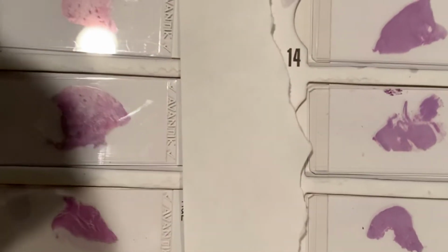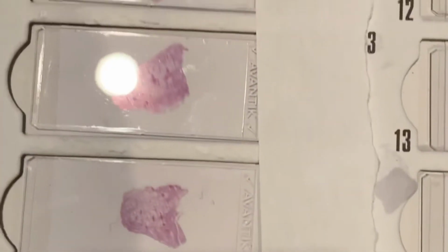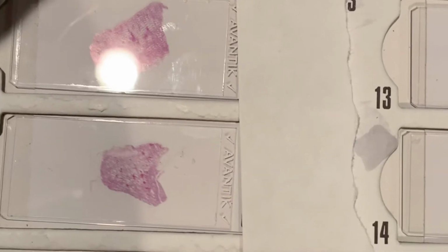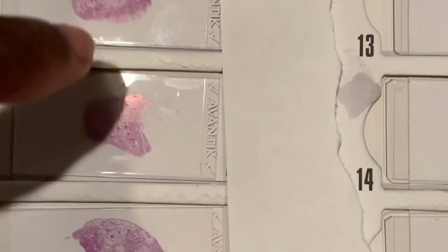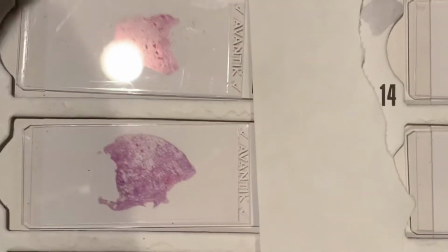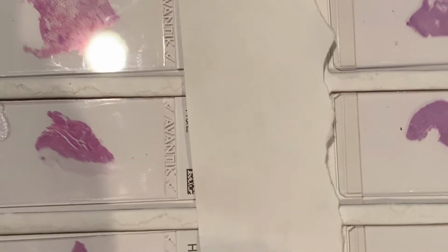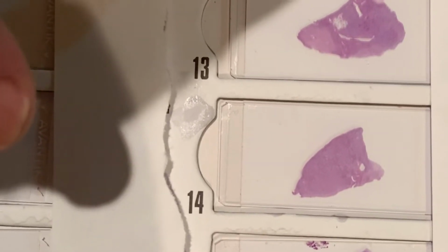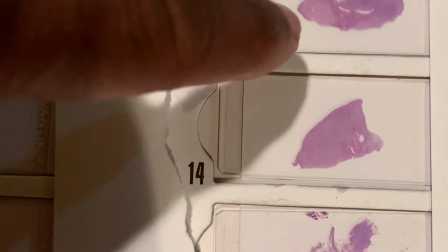Before I go through the next tray of slides, you can see that these lung sections are relatively normal. Even if you look at it, you see the spongy nature, you see the aeration and so on. And I'm not going to show you slides of normal tissue. Here's the heart section. It was very normal as well. And here's the pancreas. You can see the outline of normal pancreas, normal spleen, normal liver.